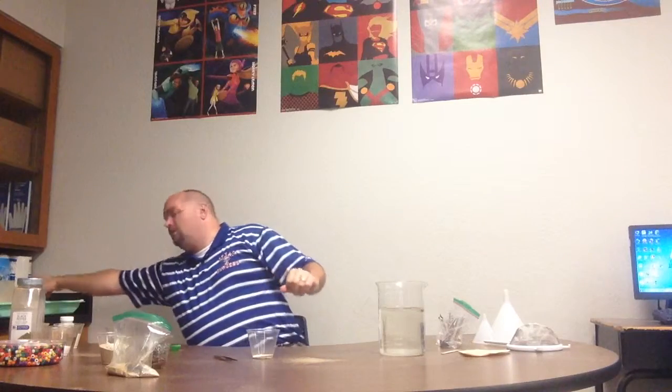So, I've got my sand and my sugar. I want to dissolve it in some water. So, a little water. A little mud here. Stir it up. My sugar is going to dissolve in the water. The sand is not, because the sand is not soluble in water, but the sugar is. So I'm going to end up with this sandy sugar water.